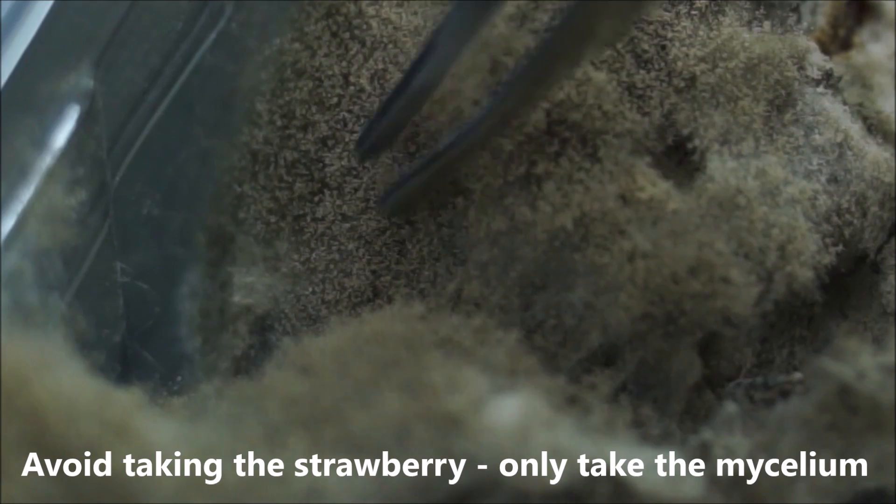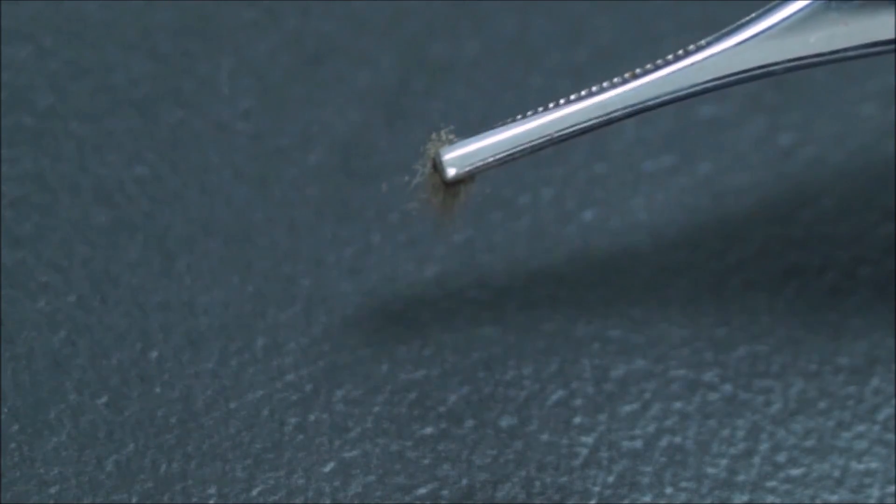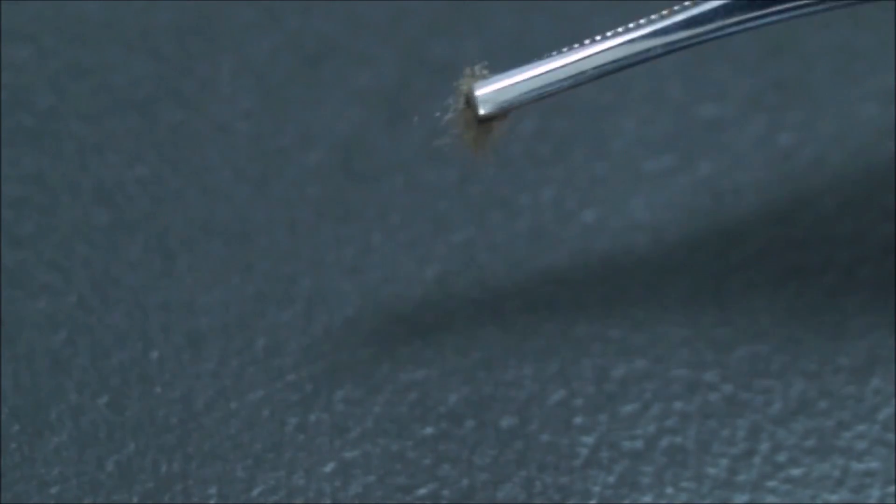You don't need very much at all. So here we go. Probably about that much. That's the amount I've picked. It's a very small amount. So let's put it onto our slide.